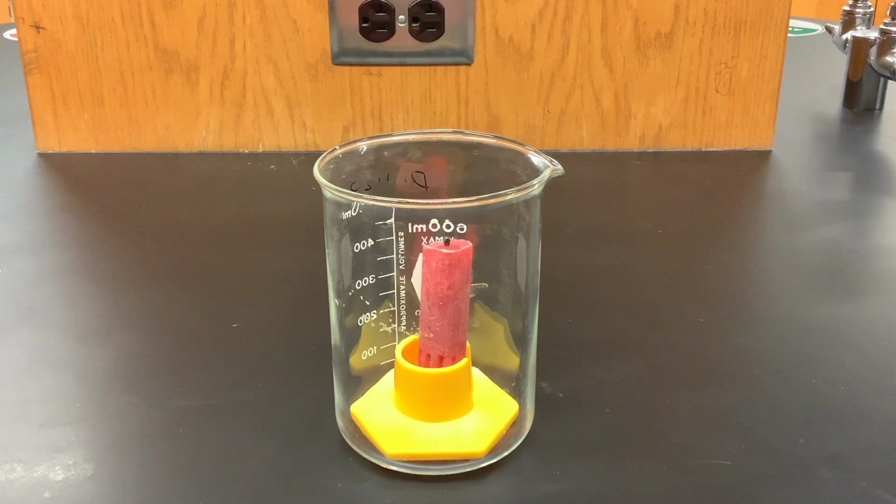In this experiment, we're going to be looking at the properties of a gas that we are going to generate through a reaction. So I'm going to take sodium bicarbonate, also known as sodium hydrogen carbonate. This is baking soda. Those of you who have done the volcano experiment in elementary school, that's what we're going to do here. The gas that is generated when we mix sodium bicarbonate with an acid is carbon dioxide gas. So I'm going to measure some of the physical properties of this gas.